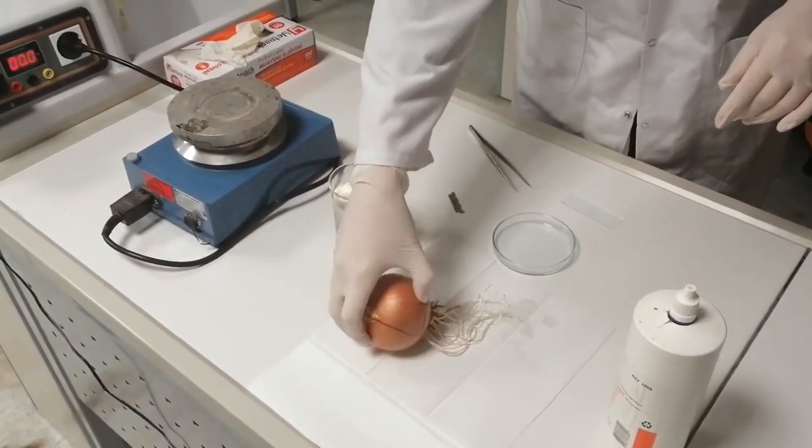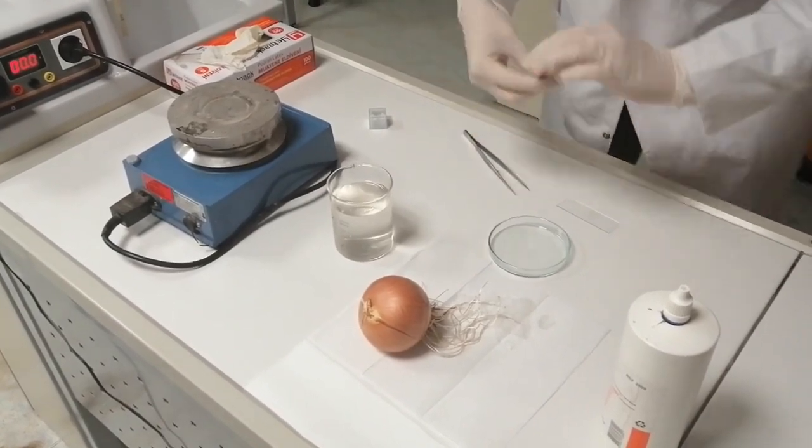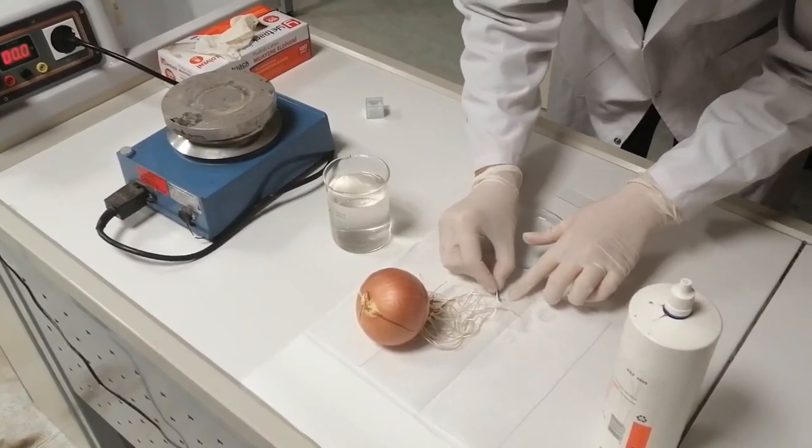Before the lab, we ensure that all the lab safety protocols are applied. Safety goggles, masks, lab coats, and gloves are necessary for this lab.